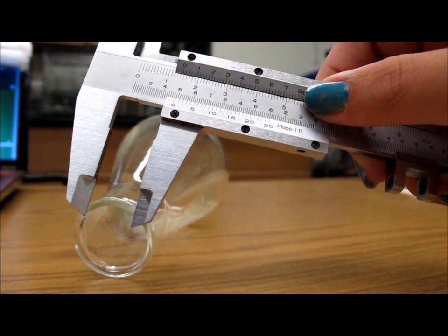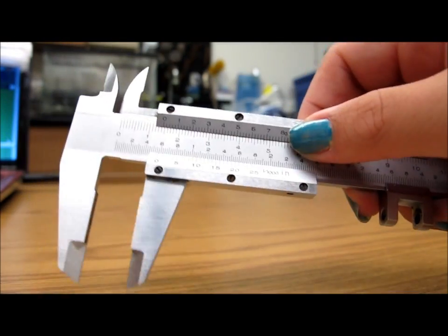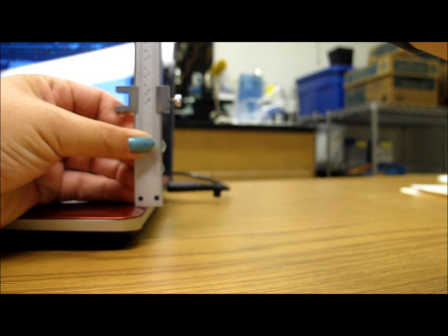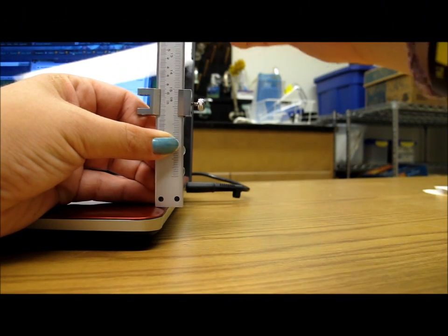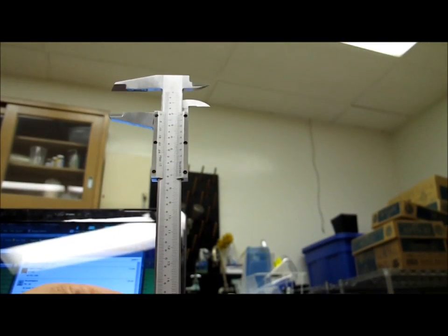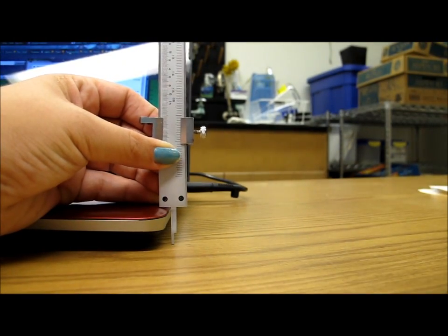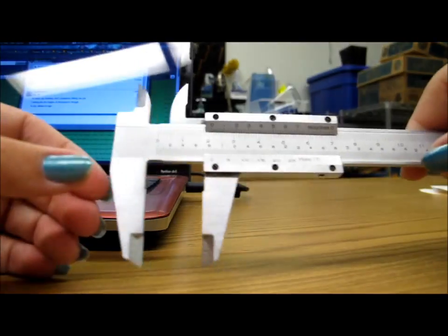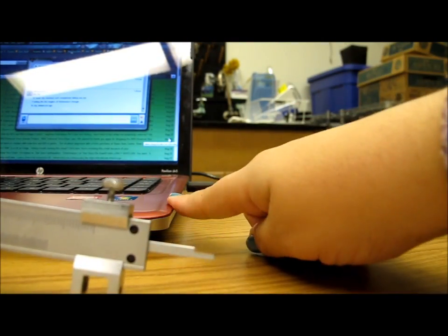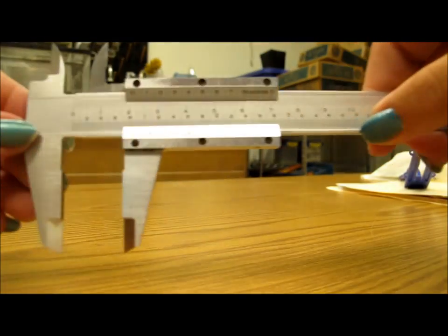So let's take how high up my computer sits. What you do is you use this. You can see that this goes down. As I'm pushing up here, see, this goes down. So then you can bring this back like that, and then you can measure this much distance as how far this went down when I was using that right there. Thank you, computer. You've done your job.